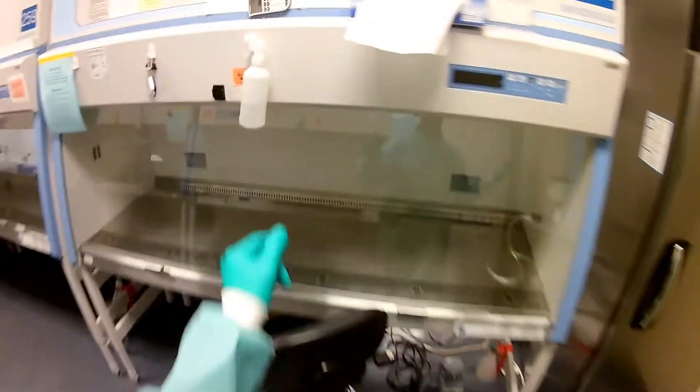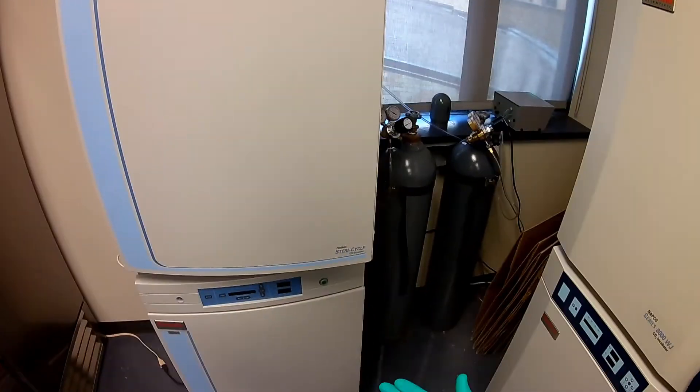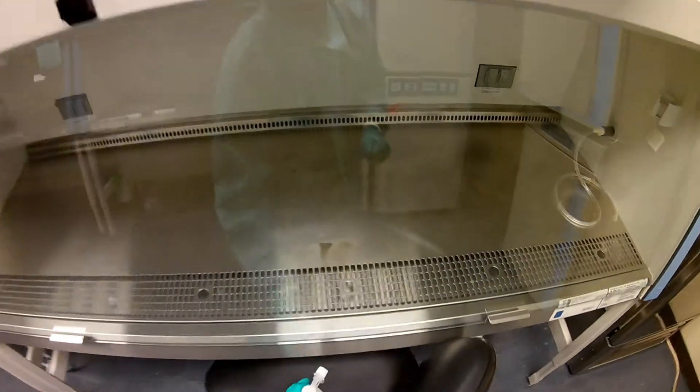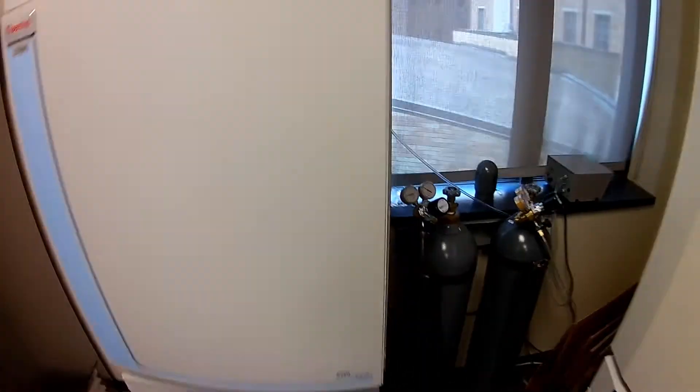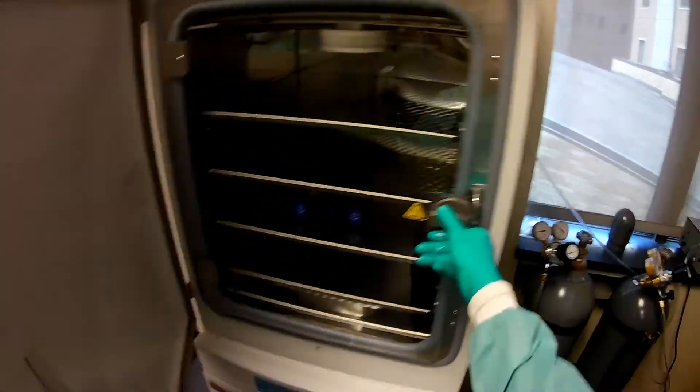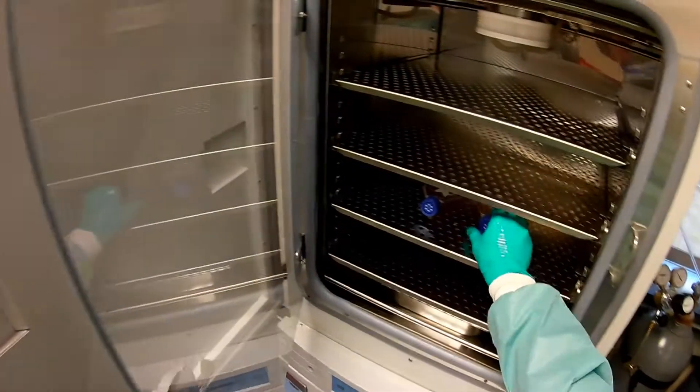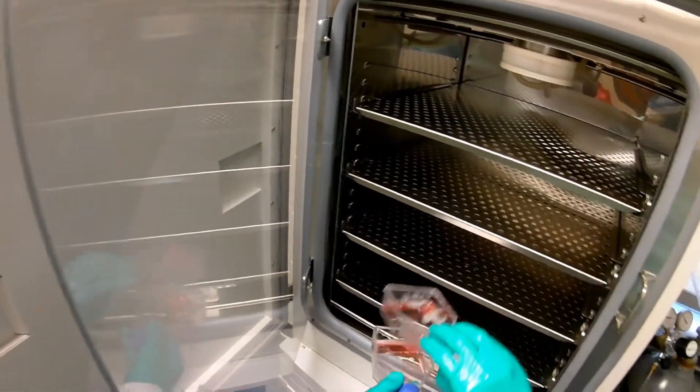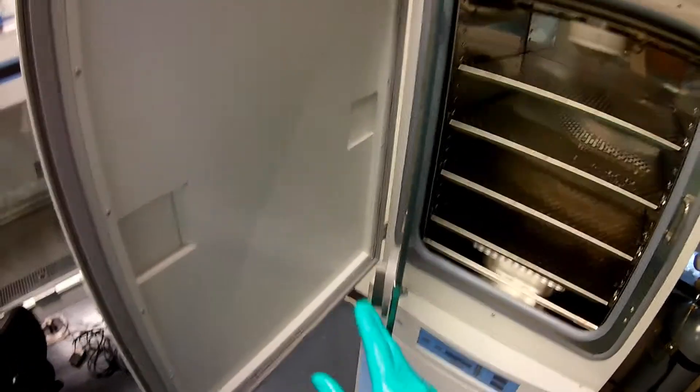So I am going to spray my hands before I get into the incubator. I hope you guys remember that's what you have to do. We want to make sure that we are not putting contaminations in there as much as possible. The incubator is not exactly sterile, but we want to keep it as clean as possible.